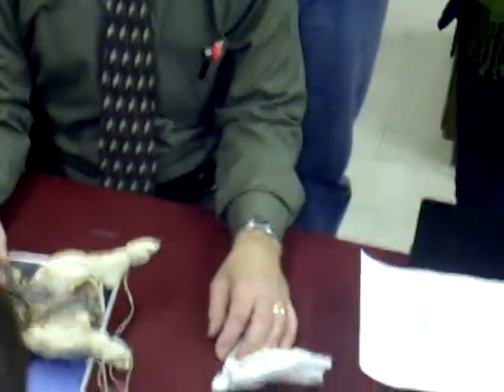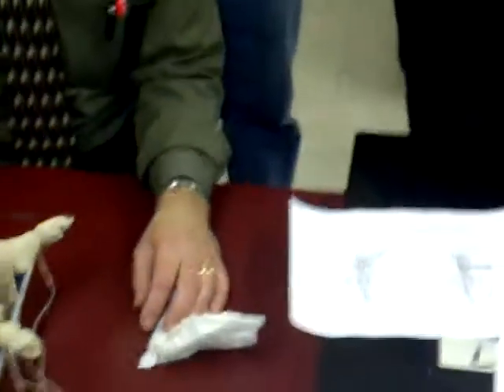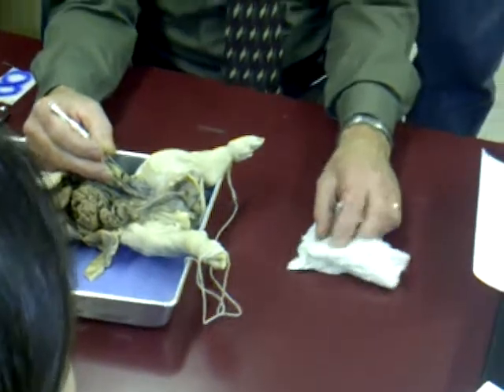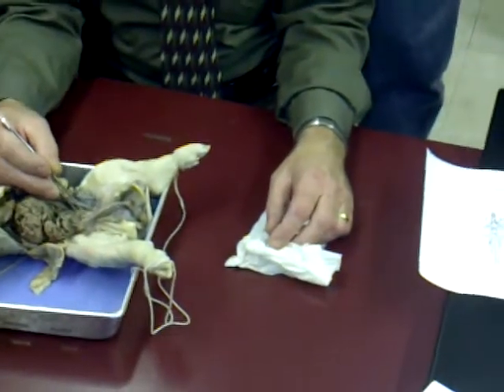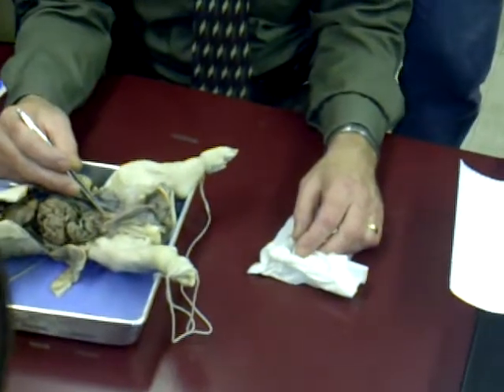that connects it to the dorsal surface of the body wall. Right, that whole long tube. That whole long tube is really, that's not the fallopian tube, that's a uterus. Now it's not well developed, so it looks like that broad ligament is pretty much a waste of time. You know, why such a big, strong thing?